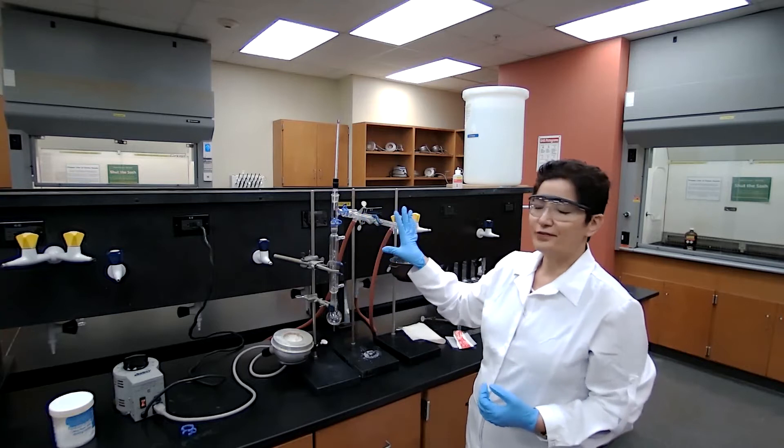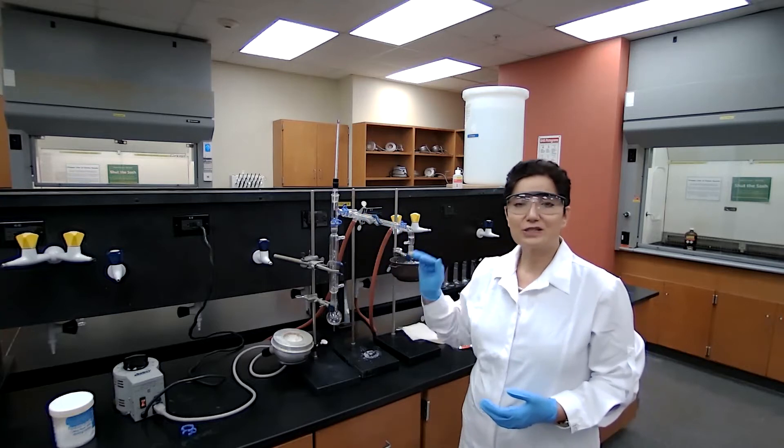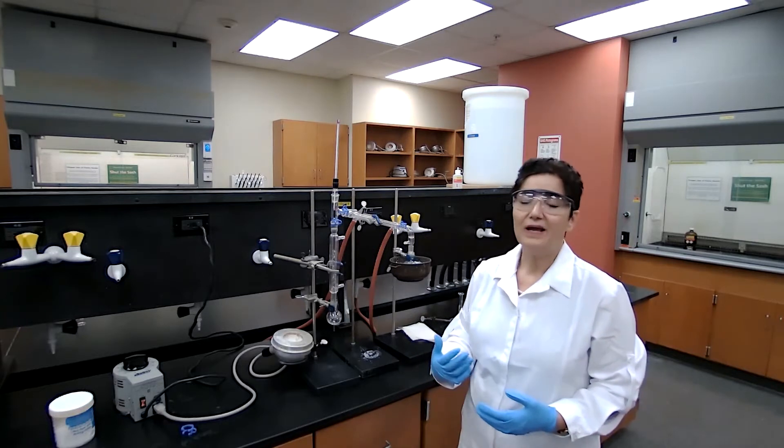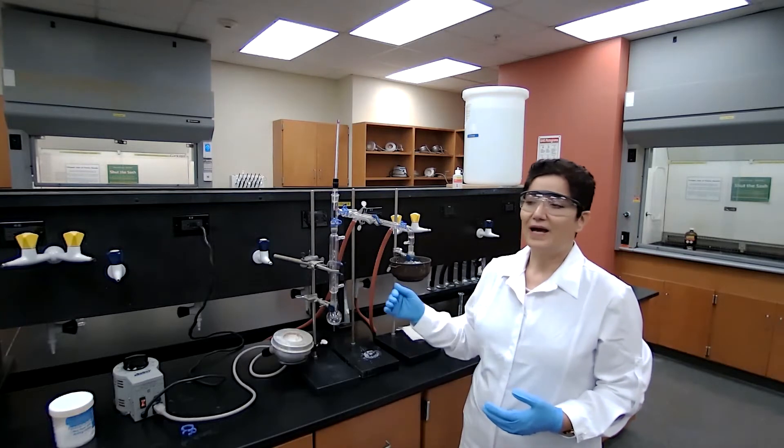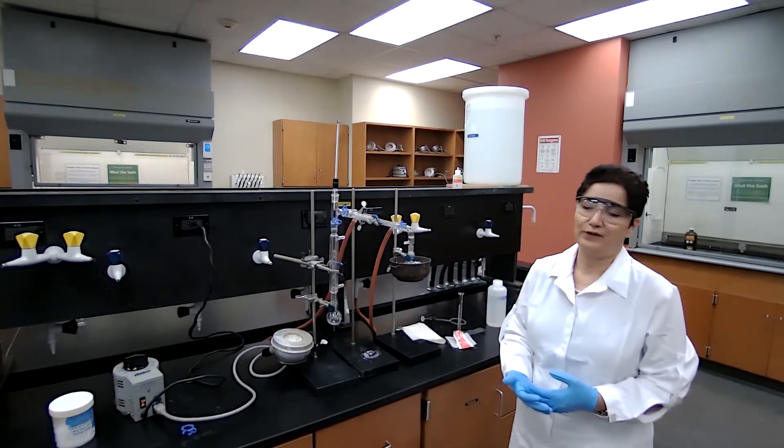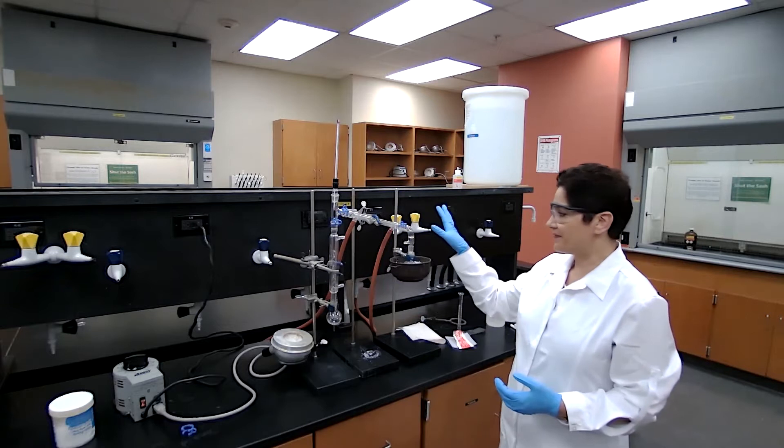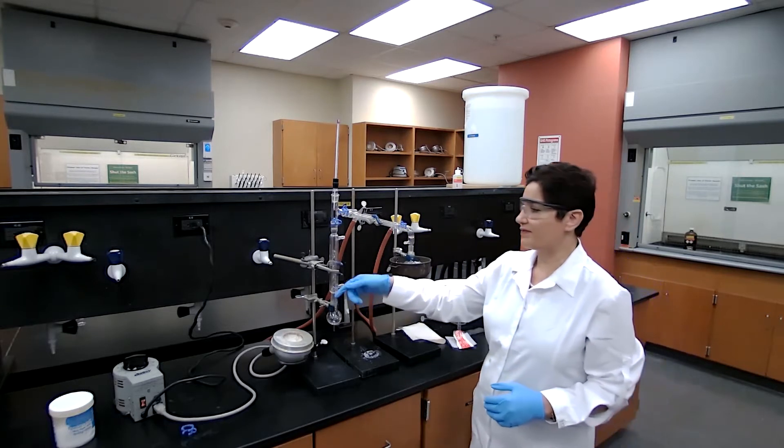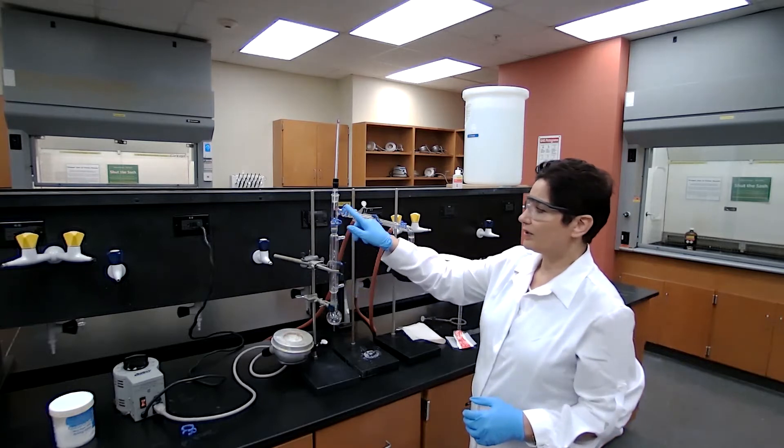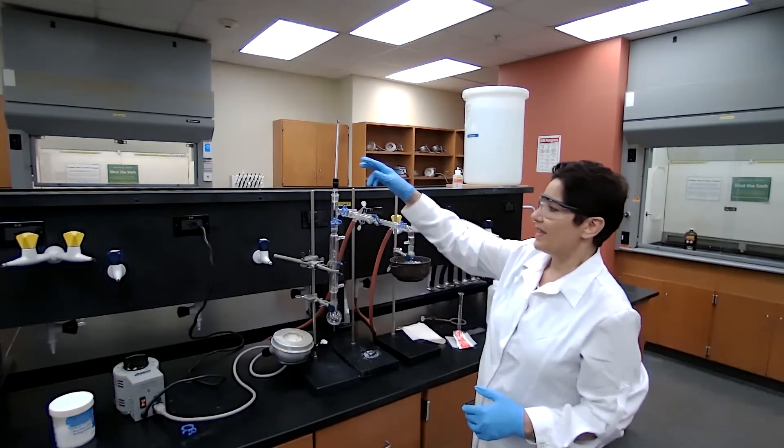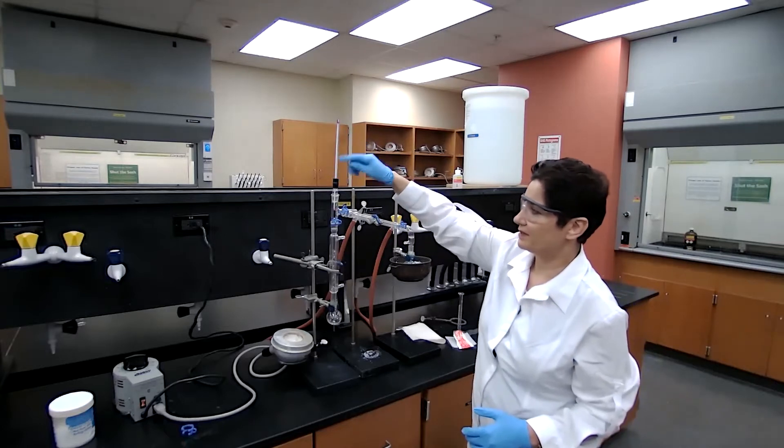The setup for fractional distillation is explained, and you have seen and performed that experiment already, part of experiment two. The instruction is also in the lab manual. So I already have set up this fractional distillation with the fractionated column. All the glass joints have been greased and clamped together, and we also have the thermometer.